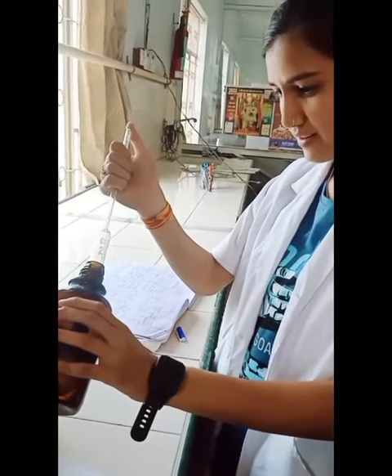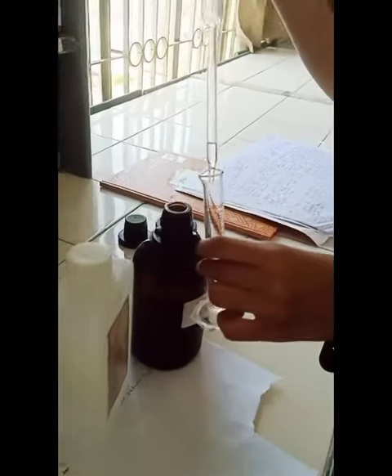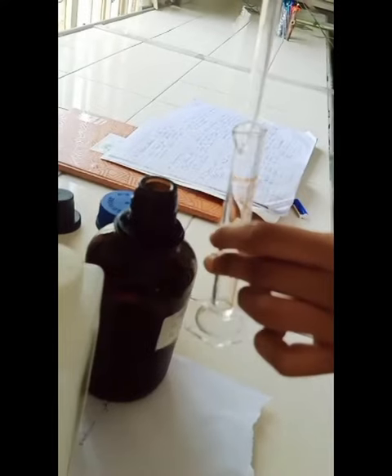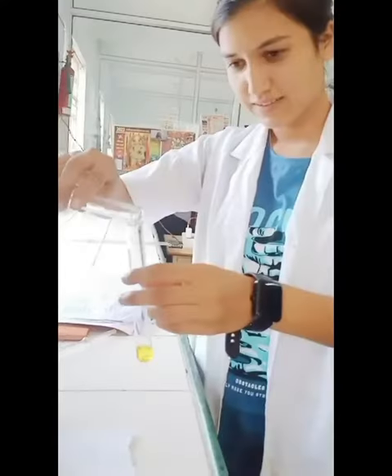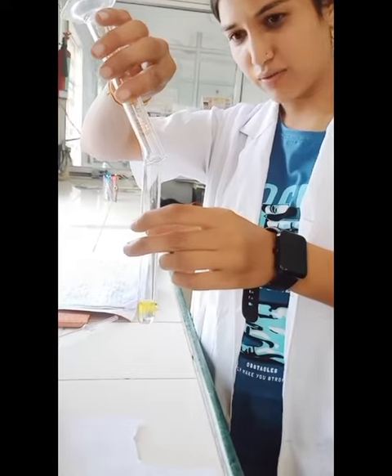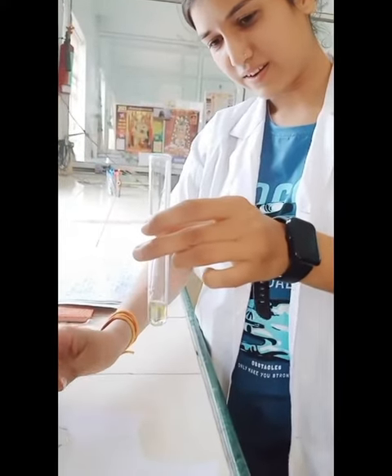The yellow color changes to green, then slightly changes into a light blue color. This color change indicates the presence of ethanol, which we observe.